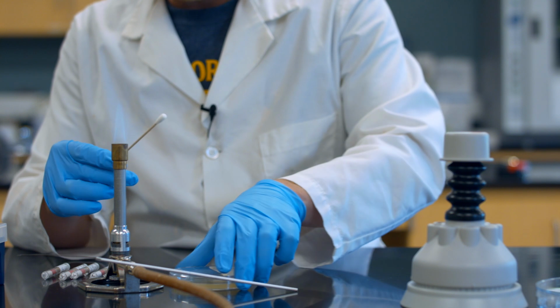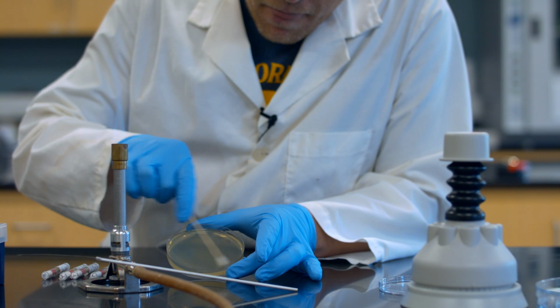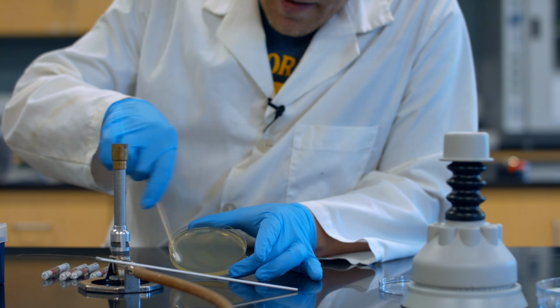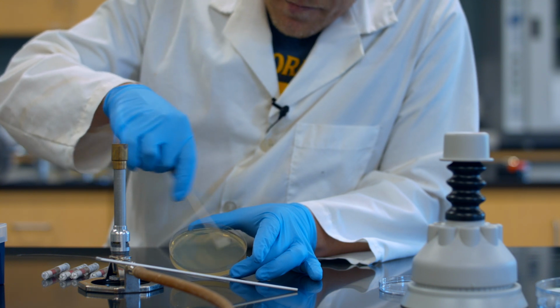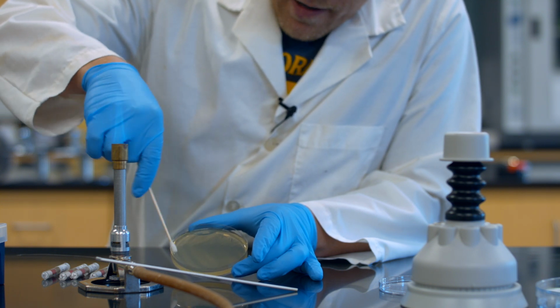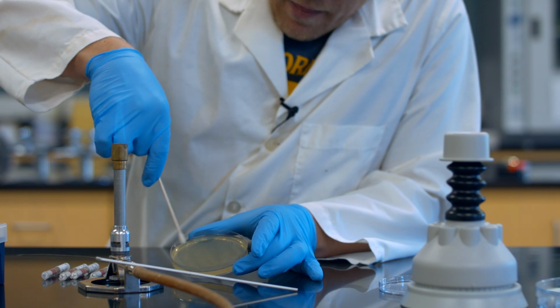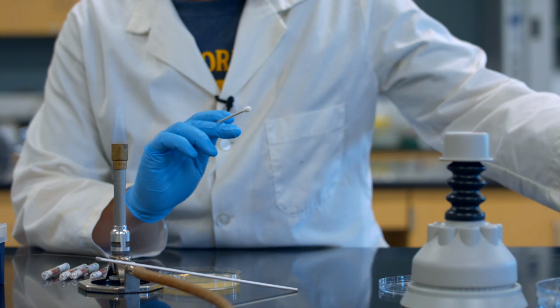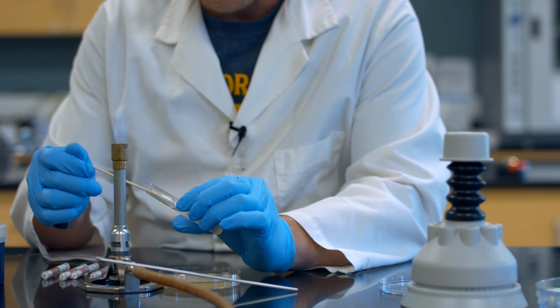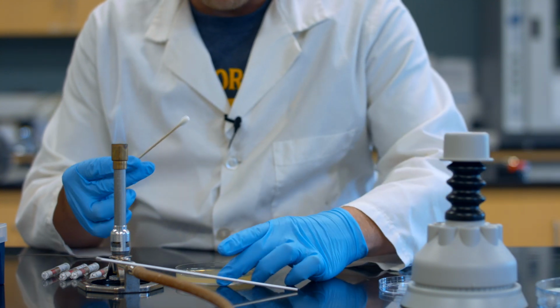And now what I'm going to do is apply it all across the entire surface in overlapping strokes. It's important that you use overlapping strokes because we don't want any gaps. Gaps will mess up our ability to interpret the halos around the discs. So you just keep working your way all the way up in one direction. Now, standard method here that I'm teaching you, we're actually going to dip our cotton swab in a second time. Same cotton swab. We're going to add more E. coli to it, and now I'm going to turn this petri dish.